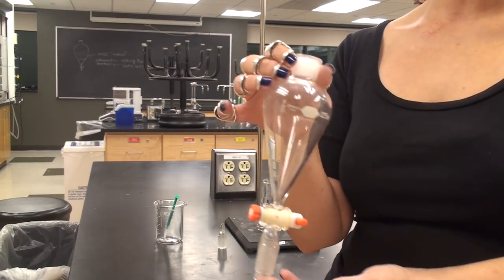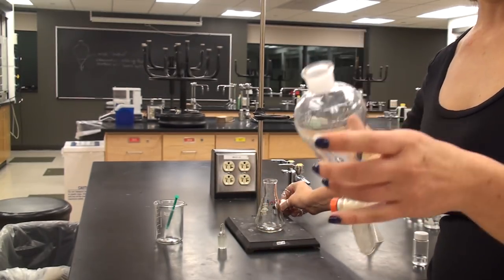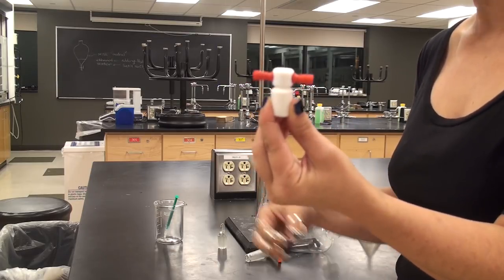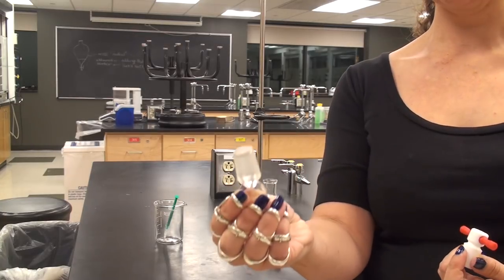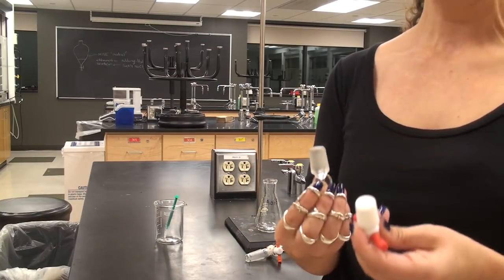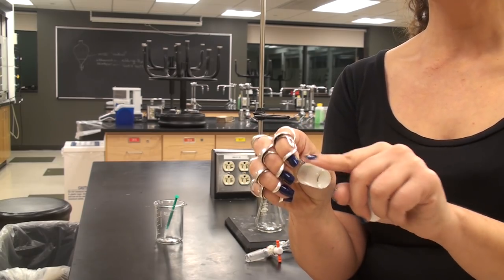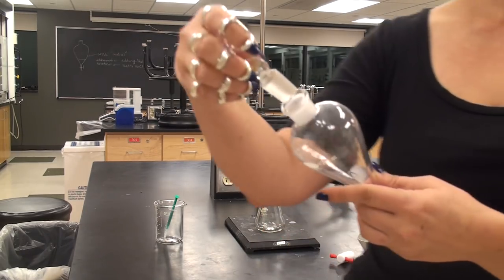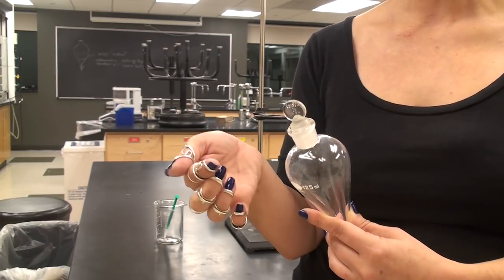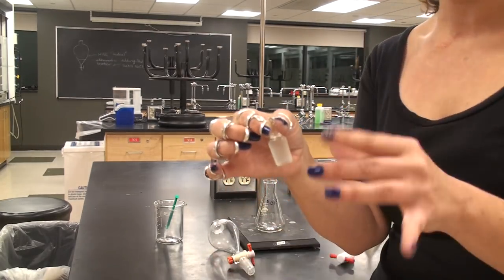This is the separatory funnel — you have one in your locker. It has a stopcock on the bottom and a ground glass joint on the top. There are two types of stoppers: plastic PTFE stoppers and ground glass stoppers. If you have a ground glass stopper, the rough surface creates tiny openings through which liquid can leak, so you need to apply grease to seal all the gaps. In the fume hood, you will find small syringes filled with grease — about a centimeter strip is all you need.